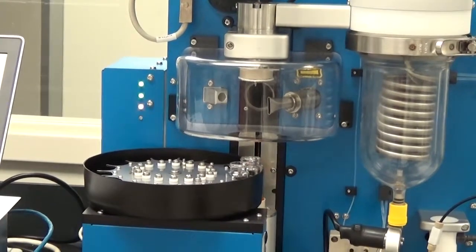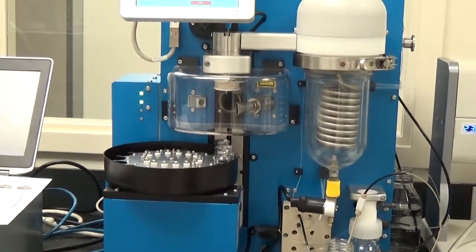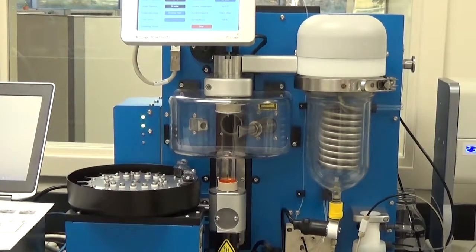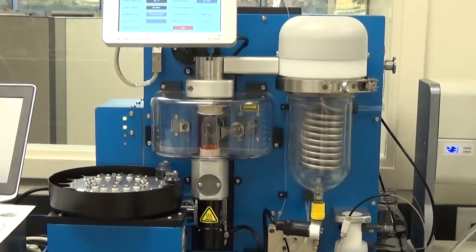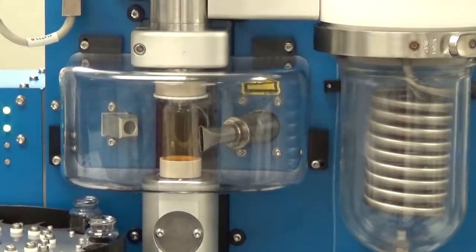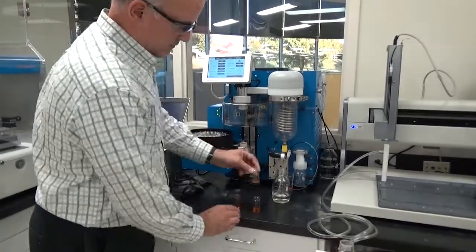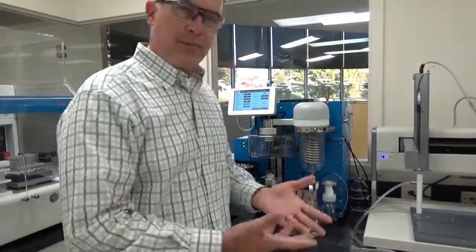Carousel's coming over. This is fully automated. Just simply use the user interface as it is. Now it's going to go ahead and start dissolving, evaporating the second vial. So now once this is all complete, I have all my vials redissolved in my new solvent, and I can take them on, cap them, and move on to the next step.